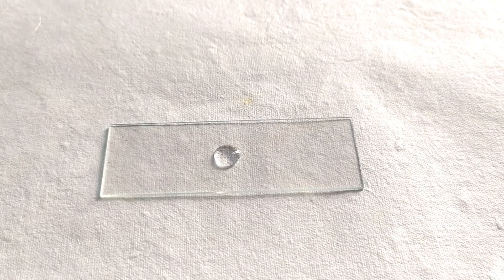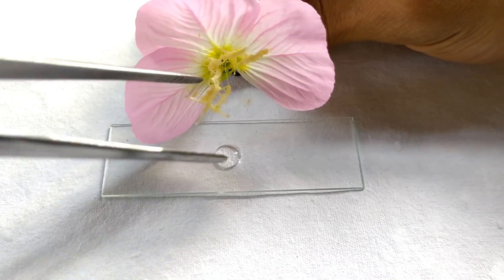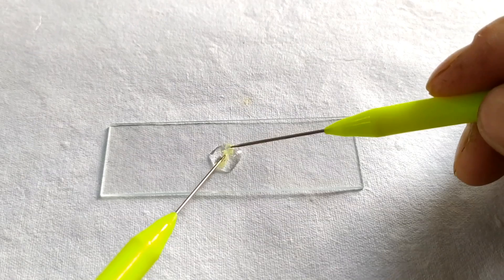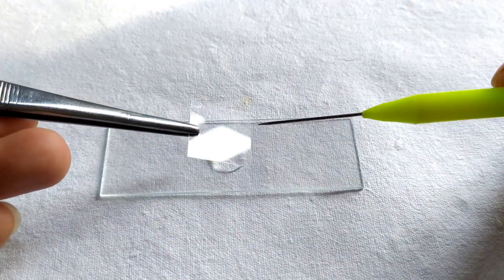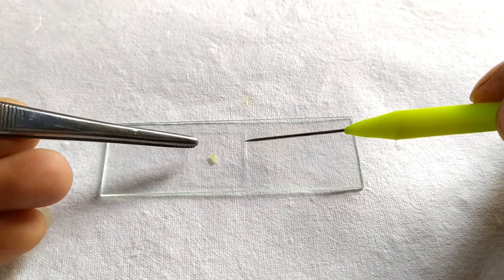Begin the experiment by collecting a flower with mature dehisced anthers. Remove one anther and tap it on a glass slide containing a drop of sucrose solution or a pollen growth medium in order to dislodge some of the pollen grains onto the medium in the slide. Cover the drop of sucrose containing pollen grains using a cover slip.